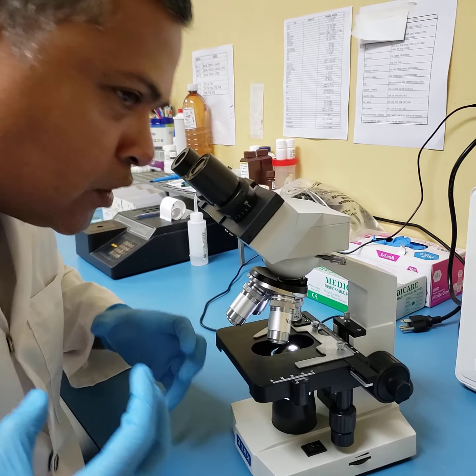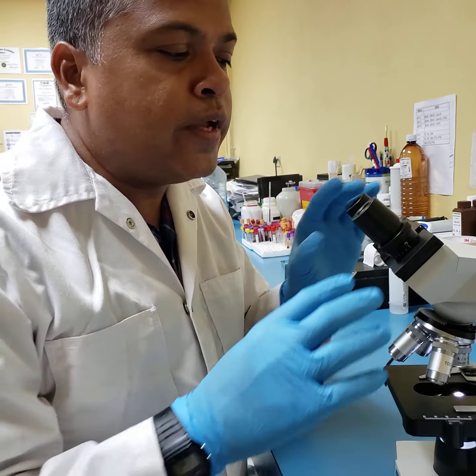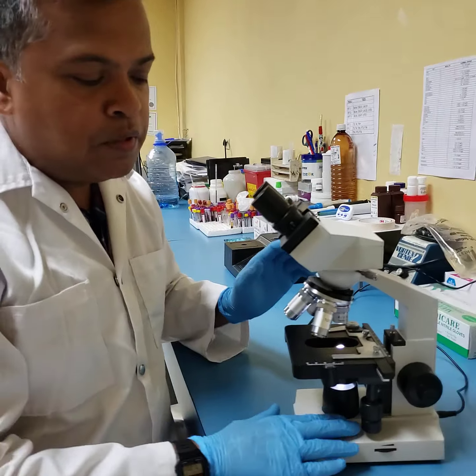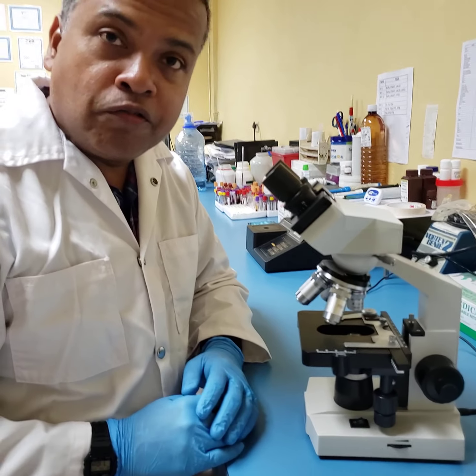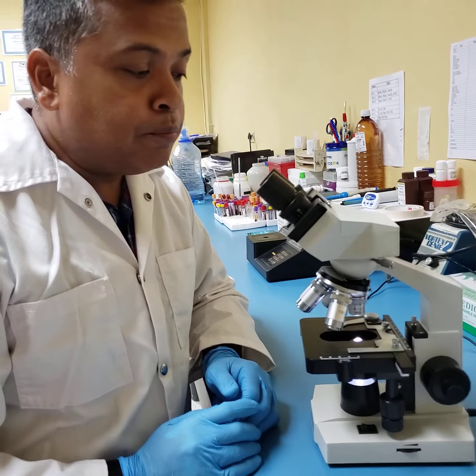I like to refer to it as one full moon, one zone of illumination. That is when you know you have adjusted your eyepieces. You cannot adjust your eyepieces with the microscope powered off. You will not see the light and you will not be able to adjust it properly.